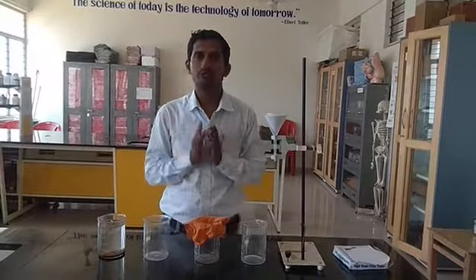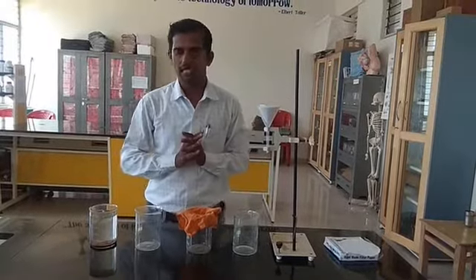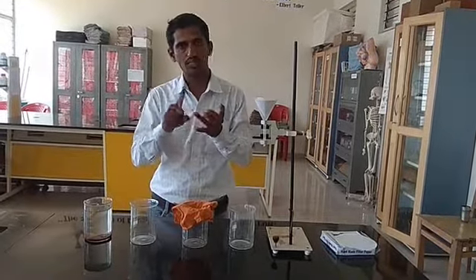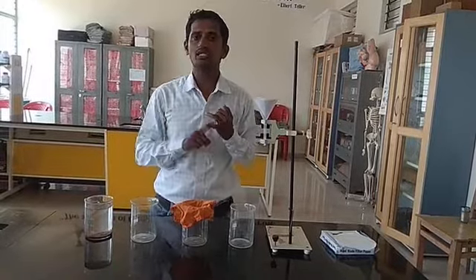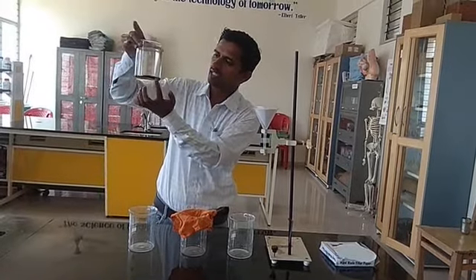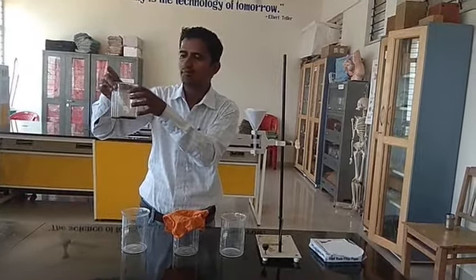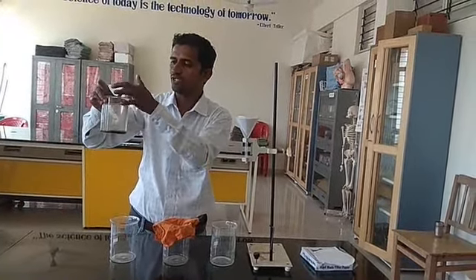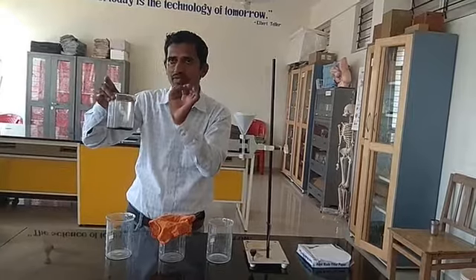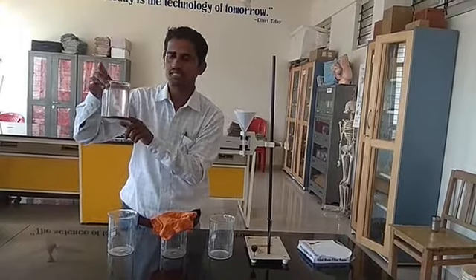You have to keep it for 20 minutes to half an hour. The soil particles are the heavier component of this mixture of water and soil. Being heavier, the soil has settled at the bottom of the beaker — you can see that here. The remaining lighter components, including water and light impurities, remain on the top layer. This process is called sedimentation: if the heavier components of a mixture settle at the bottom, it is called sedimentation.